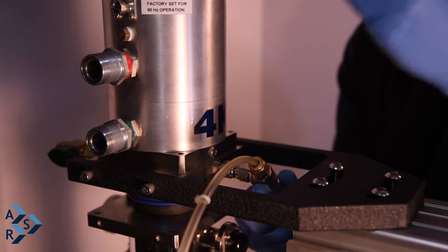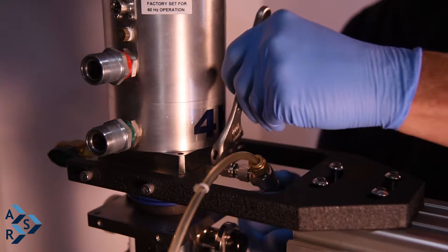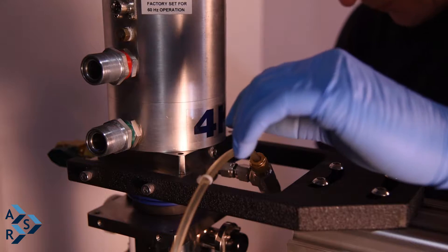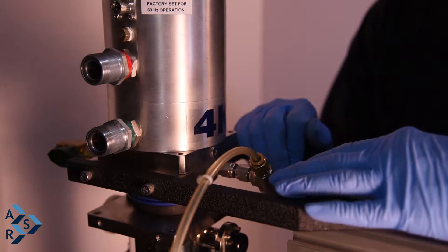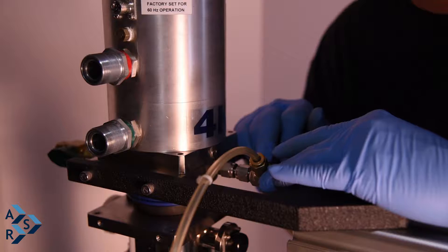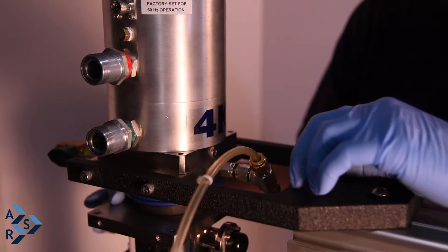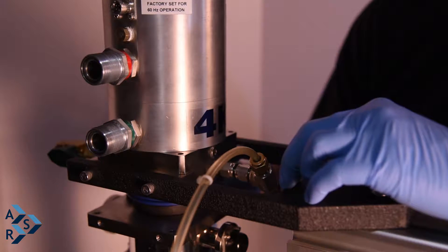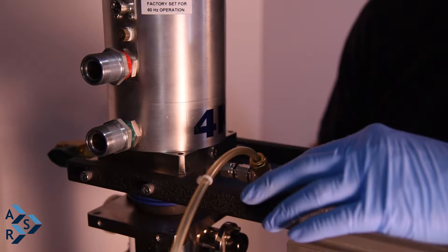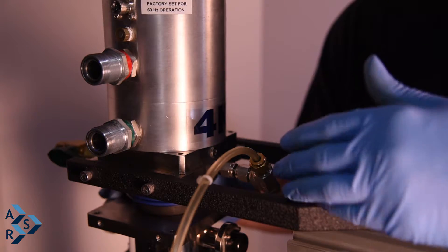Reposition the fitting — you can put it one way or in the other direction, whichever works best — then retighten and make sure you have a nice snug fit. If you have liquid snoop available, which Swagelok sells, you can make sure you don't have any leaks when purging your gas to charge and vent the bellows. Also run some liquid snoop around the seams of the bellows to make sure you don't have a large amount of gas escaping, to prevent excess helium consumption.